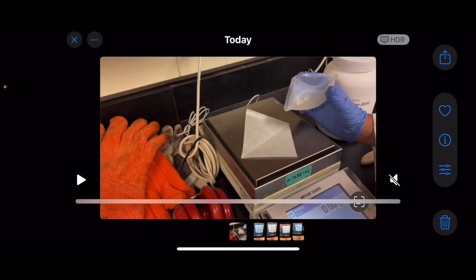So what I'm doing is I'm going to make a BSA stock, a 10% stock, and I'm going to measure the OD 280 of it using a nanodrop, and then I'll dilute it and take the OD 280 of the dilutions. I'll be diluting it with the Opentrons mostly, and also do one dilution of my own to compare.